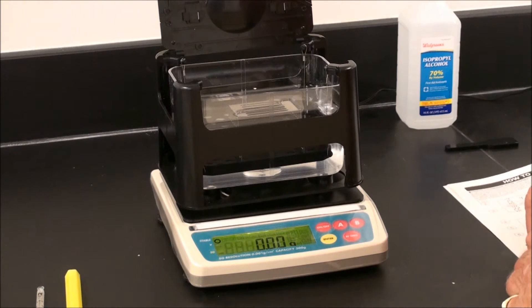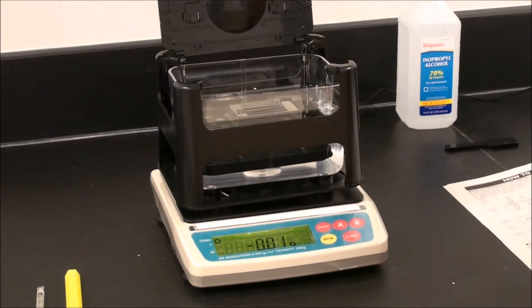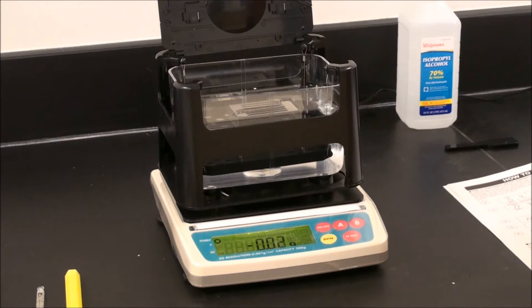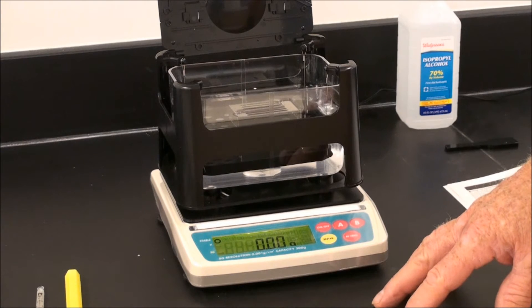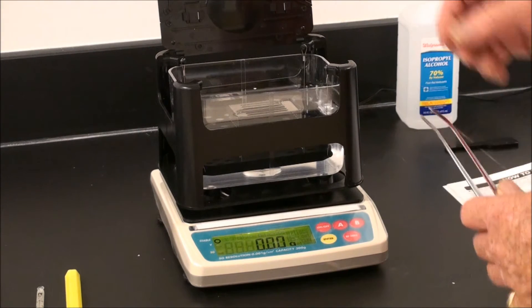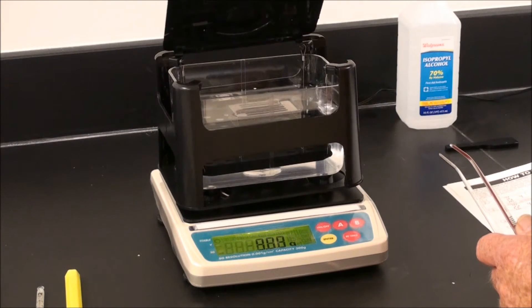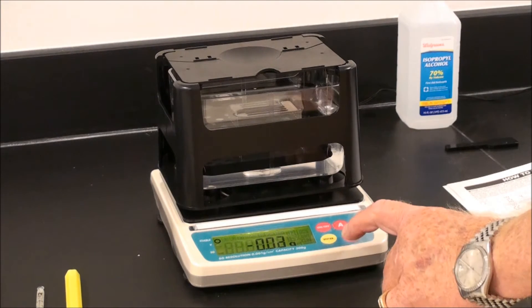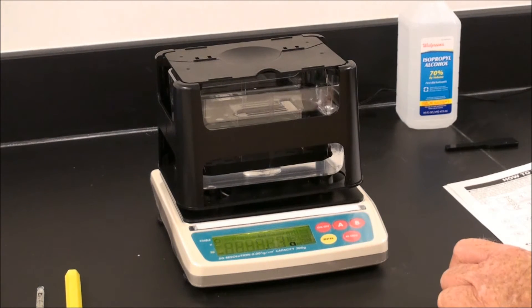In practical operation, the windscreen should be placed around the instrument, as even the motion of air from your hand can offset the balance. It is critical that the table be level, that the balance be level using the mark on the rear of the instrument, and that all air flow is directed away from the instrument. Close the sensor stage, re-zero, and we are ready for the first weighing operation.